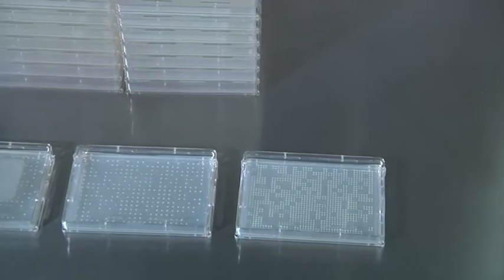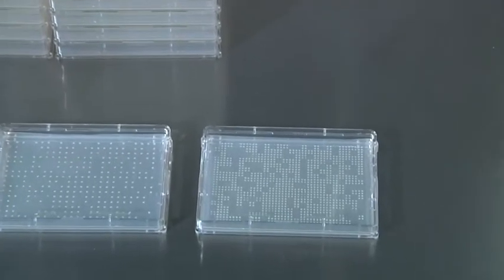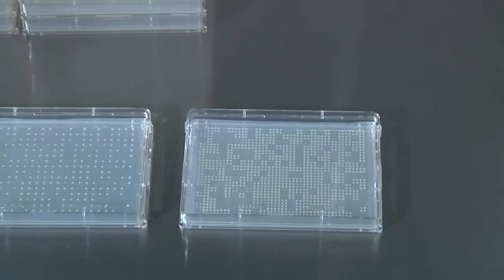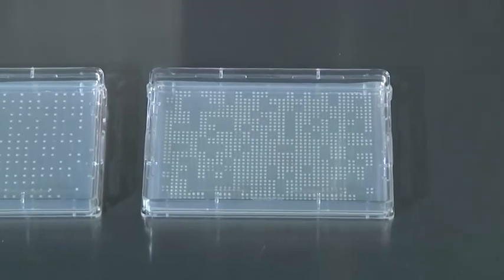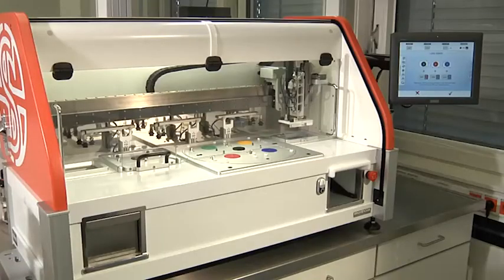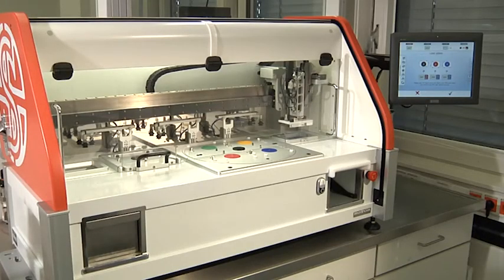Sometimes we need to cross hundreds or thousands of yeast strains, or we want to test many strains under different conditions. In the lab, we use a special robotic system which duplicates tens of thousands of yeast colonies in one step.